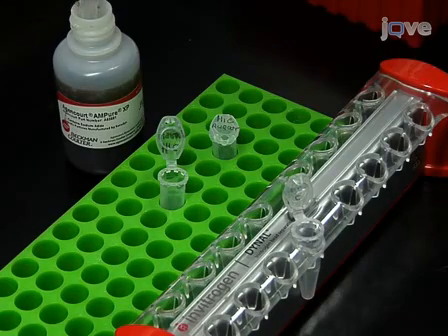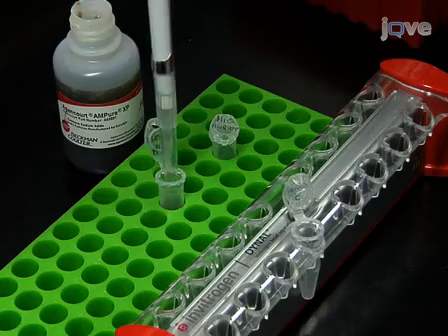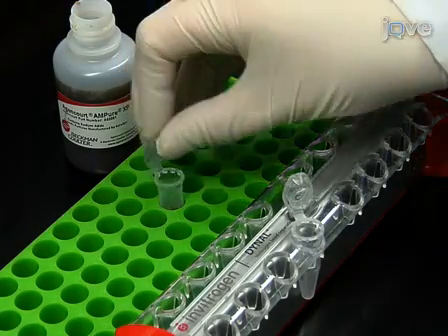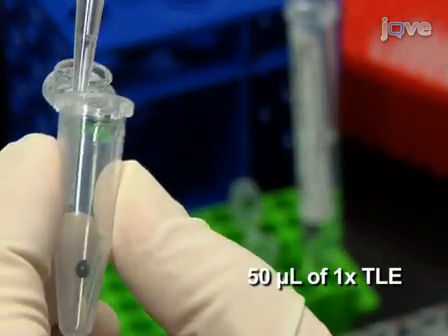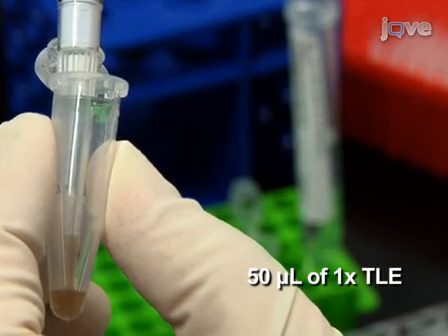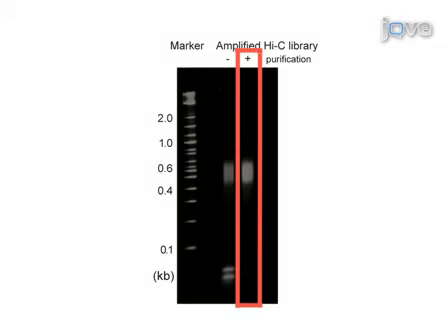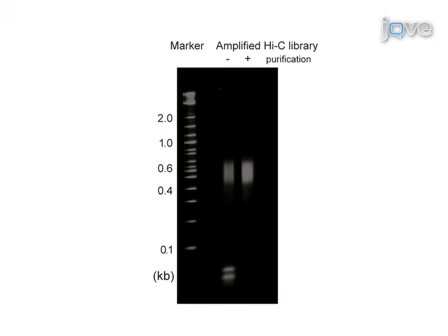And purify the remainder of the PCR product with 1.8 times volume Ampure beads according to the manufacturer's recommendations. Elute the DNA with 50 microliters of 1x TLE buffer and compare 1% of the Ampure bead purified PCR product to the 1% aliquot of the original PCR product on a 5% polyacrylamide gel, ensuring the successful removal of the PCR primers.